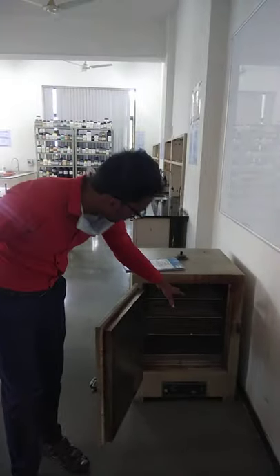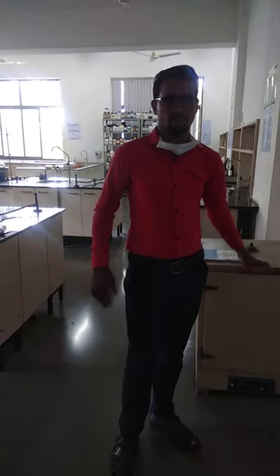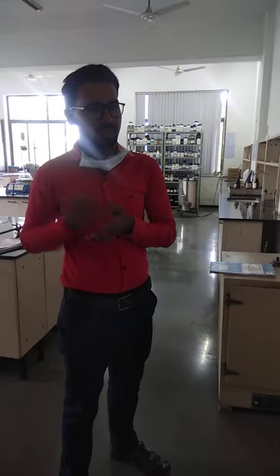We have another instrument which is the hot air oven. Let's see inside — you can see different racks. On these racks you can keep your samples. The hot air oven is used for the purpose of dry heat sterilization. In this particular instrument, you are going to sterilize your apparatus — specifically glass apparatus can be sterilized under this instrument.